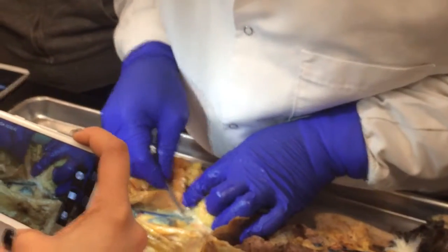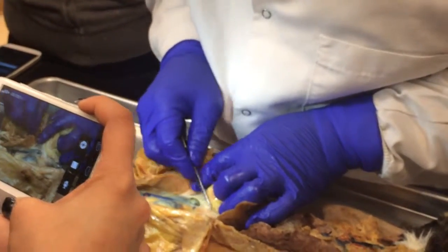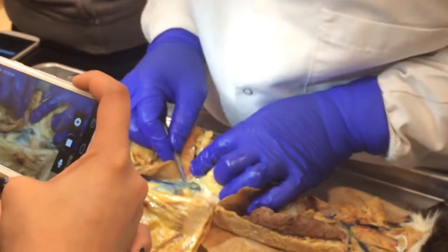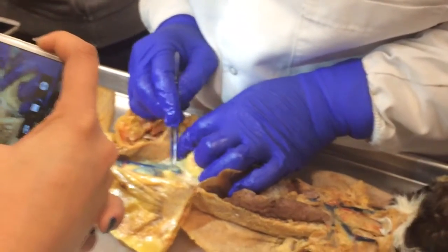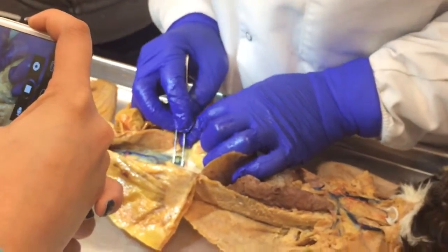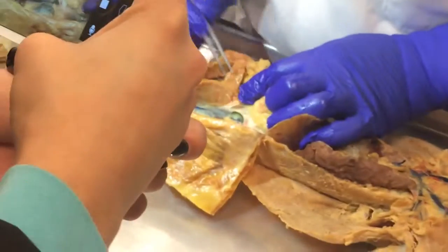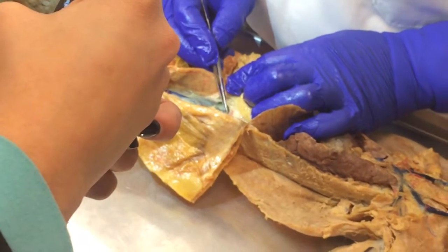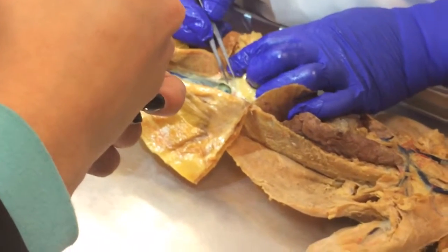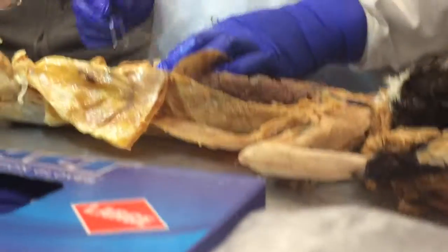You may put a sticker right there? I'm not going to ask about it because it's part of the urinary system. You see that? Okay. Some of this fat is holding it, but I would say this would be the adrenal gland. You see this? And this would be the adrenal lumbar vein, which goes to the adrenal gland. Is it going to be on the exam? No, that won't be. Don't be shocked, I'm not going to give it.